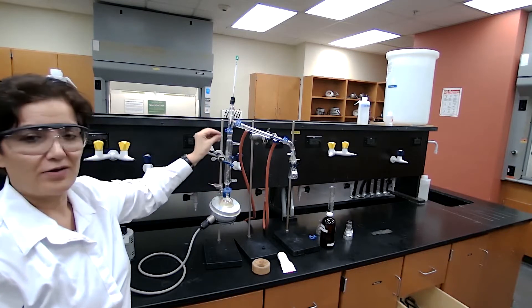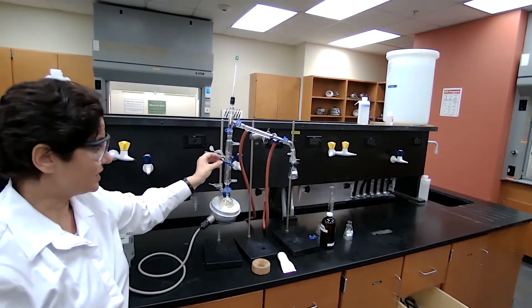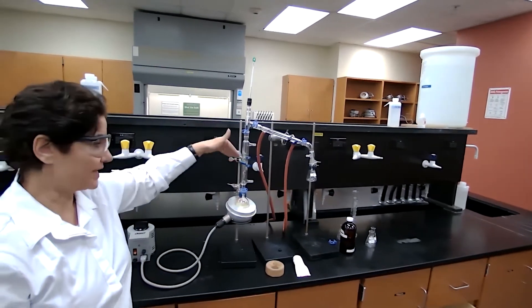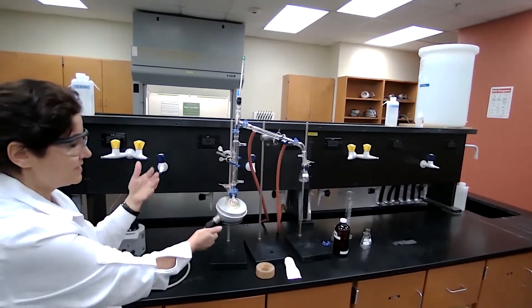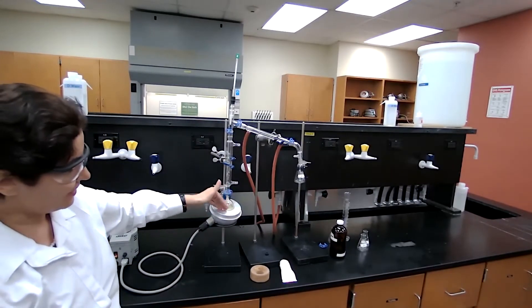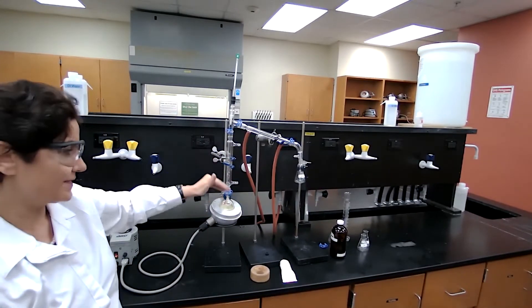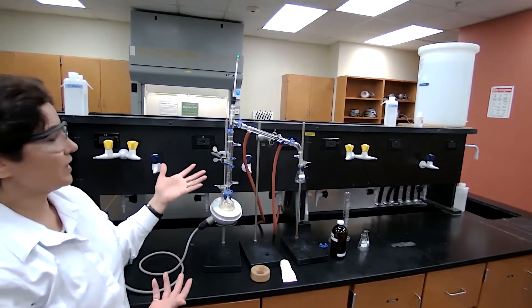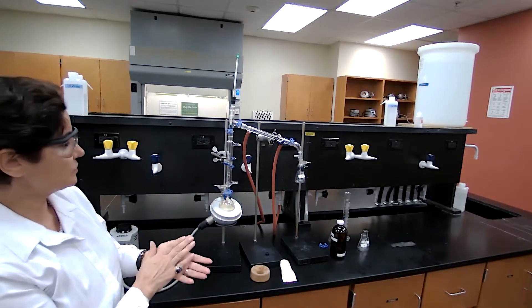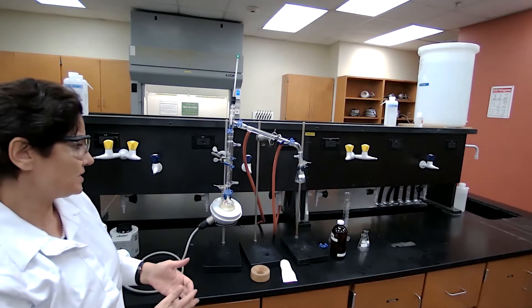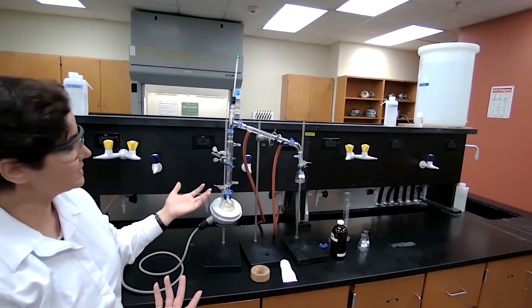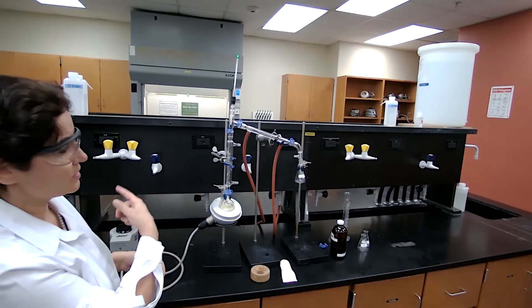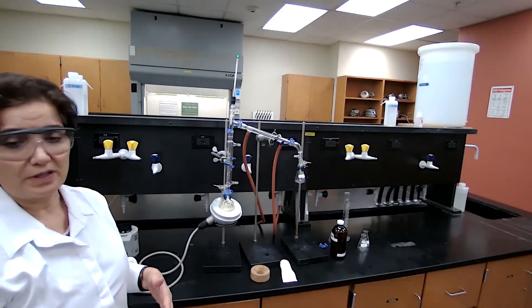Understanding that in fractional distillation, there is a fractionating column. It's putting those vapors back, condensing, putting it back, so you will see some reflux and condensation, evaporation condensation happening right here. And it takes some time. So I'm going to pause the video at this point, wait until it boils, and then I will show you the steps. Because it takes a long time, I don't want the video to be too long.